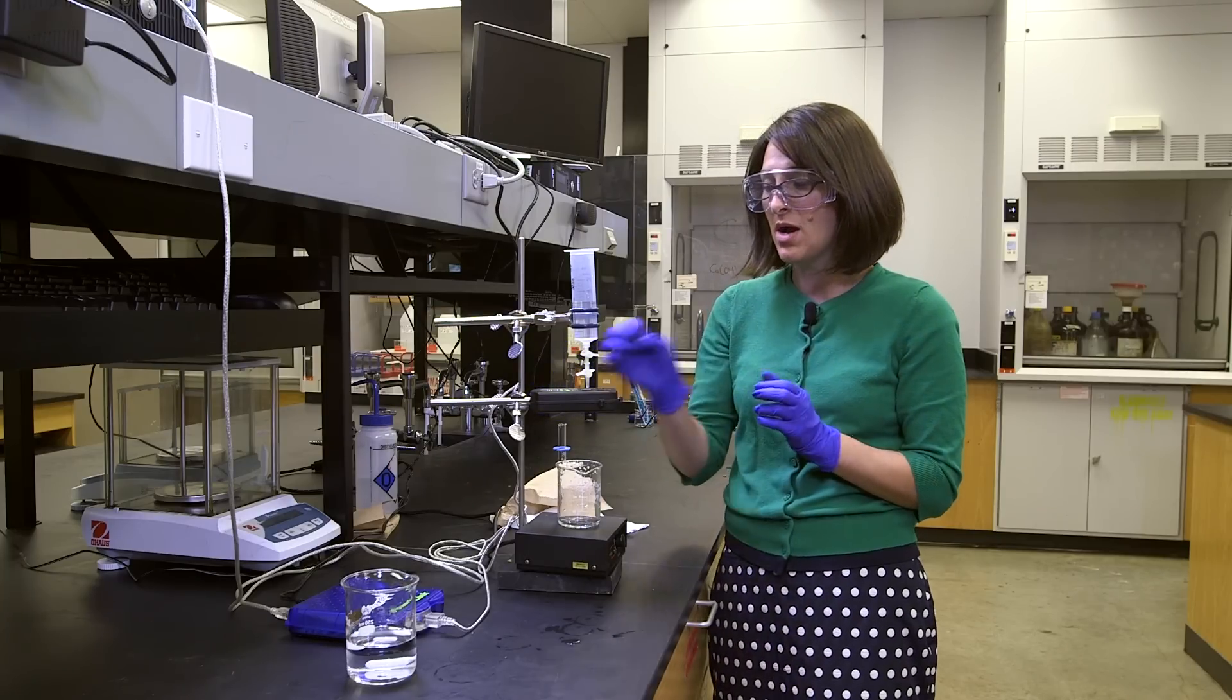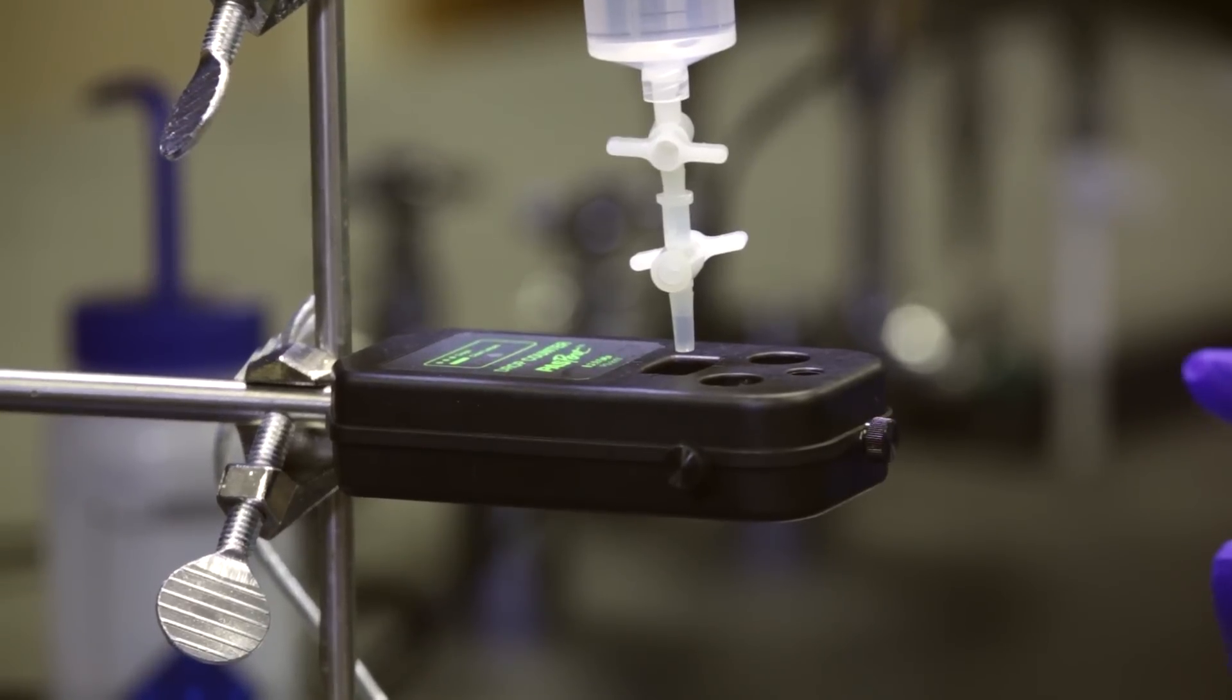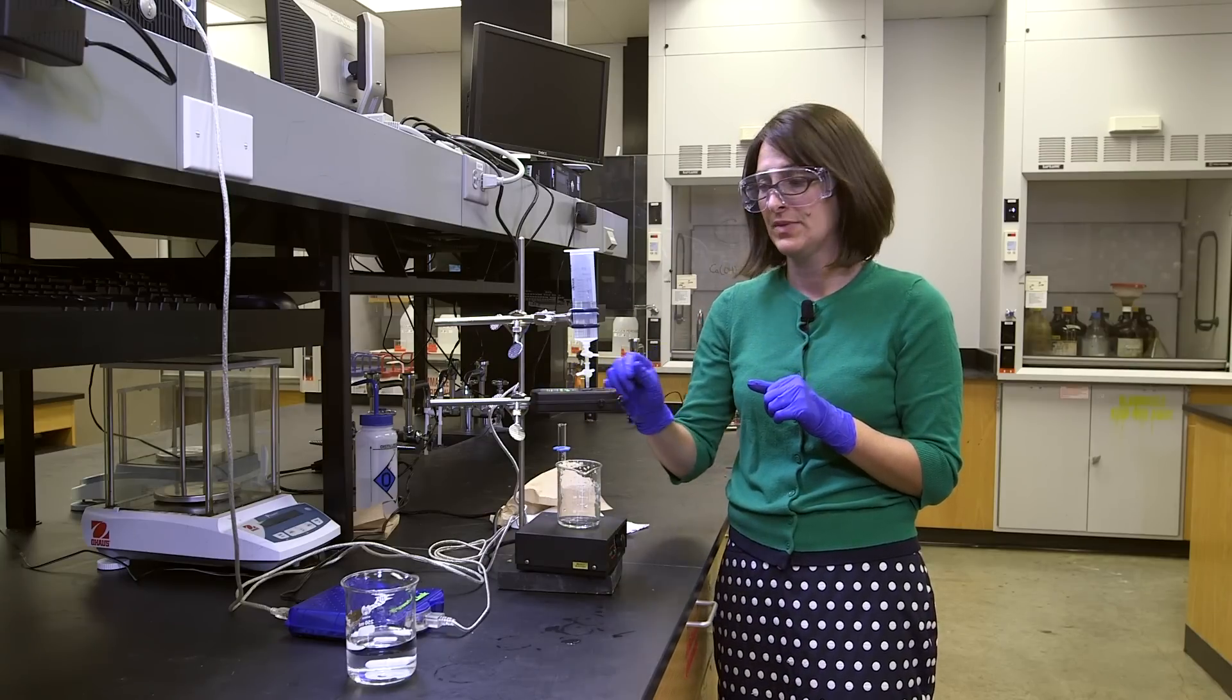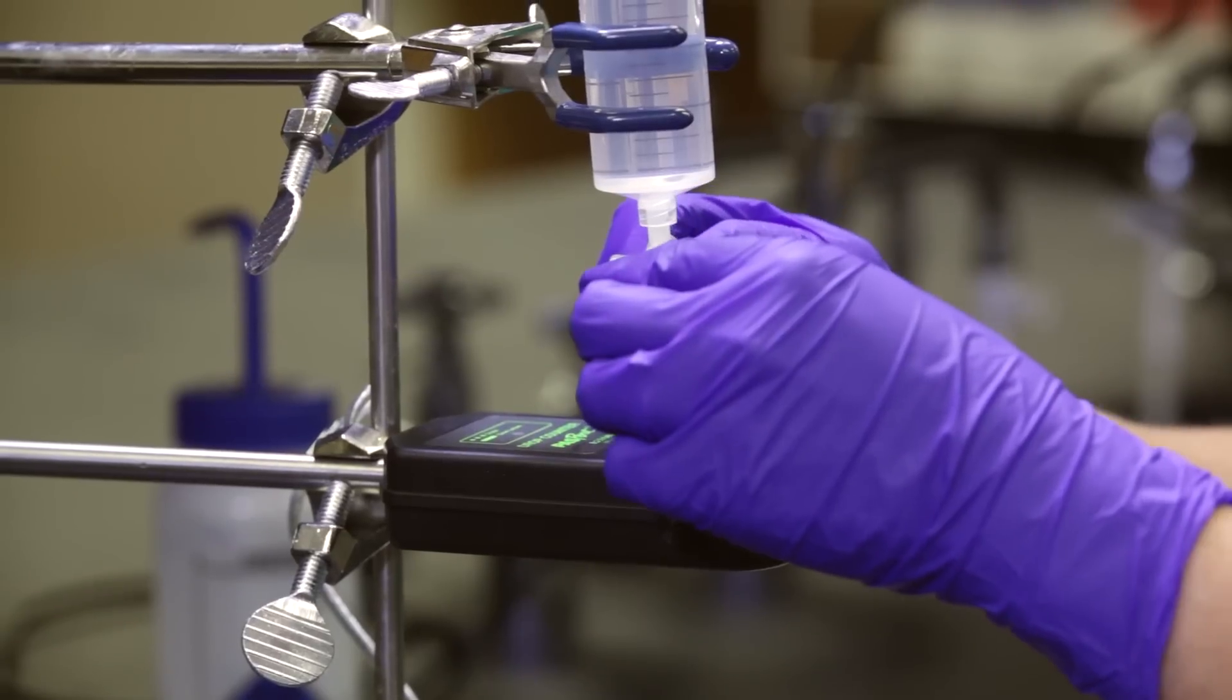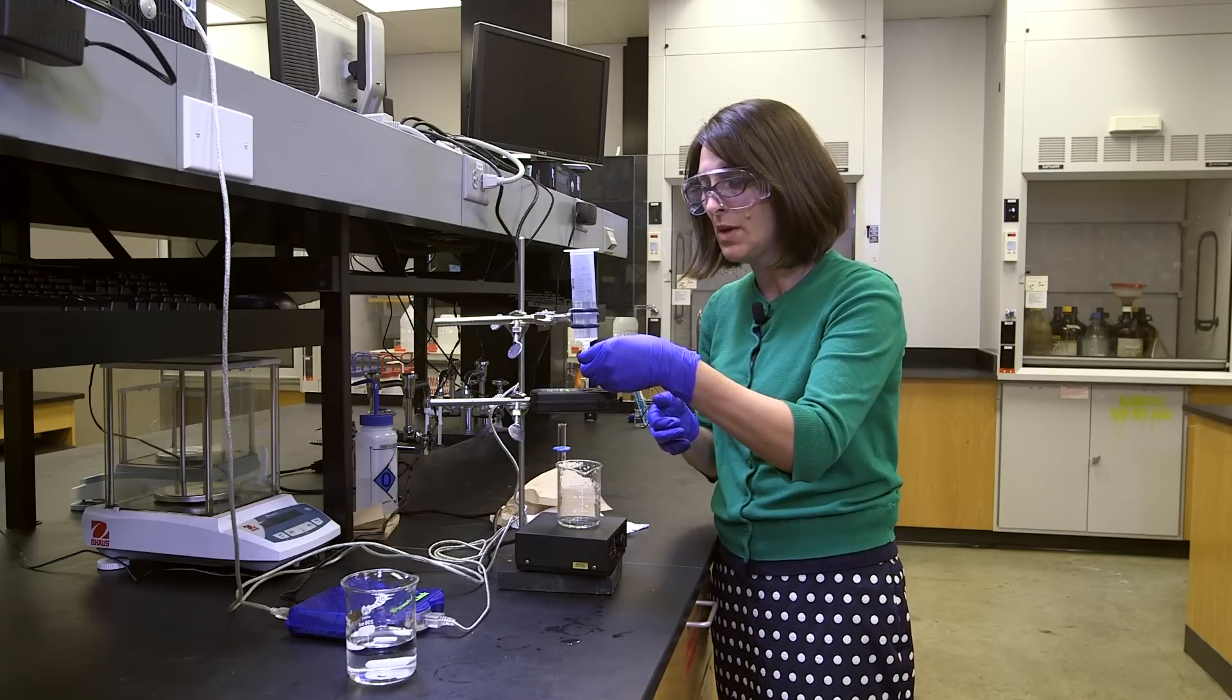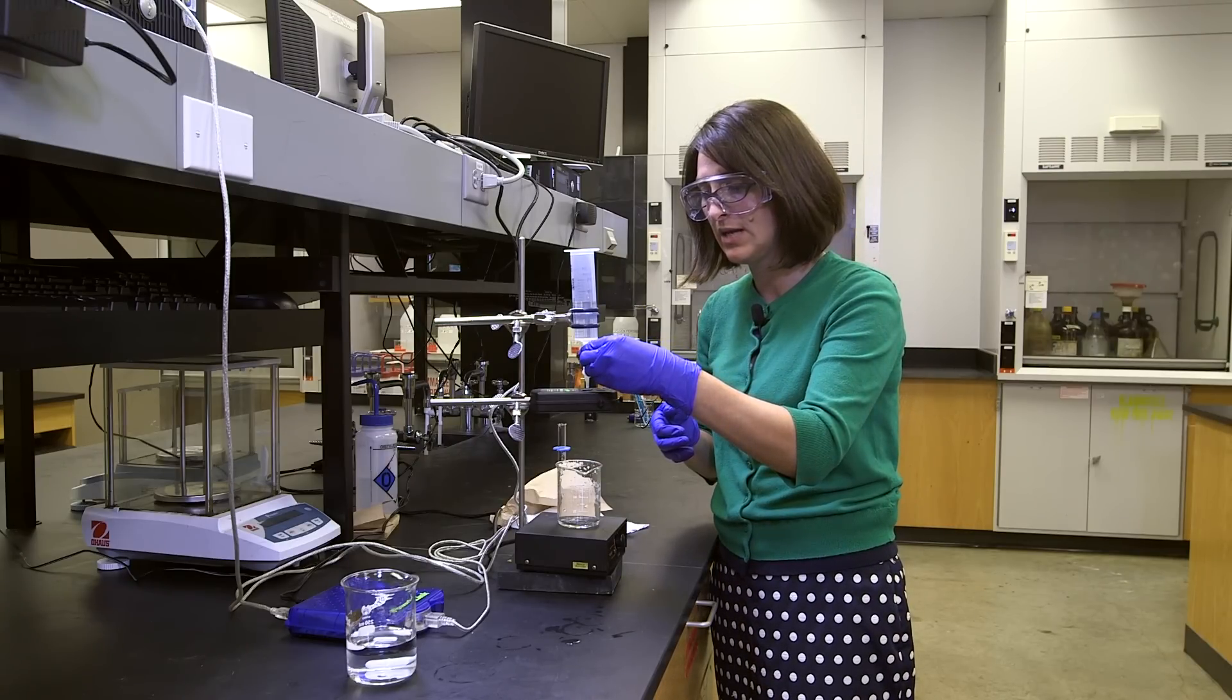I have two stop cocks on my plastic syringe. I'm going to adjust the flow rate. So, how many drips per second with the top? And then the bottom is just going to be on or off. So off, meaning that horizontal bar, both are off. I'm going to open the bottom, meaning a vertical bar. And then I'm going to start slowly opening the top one.